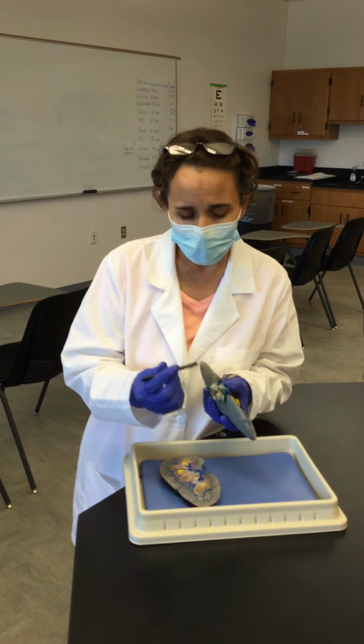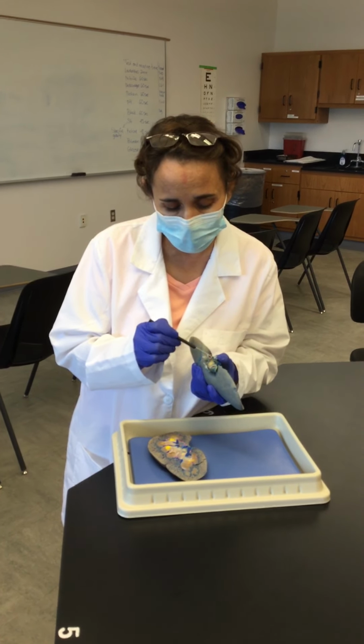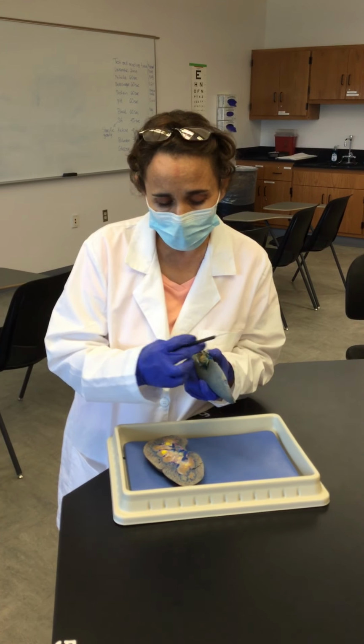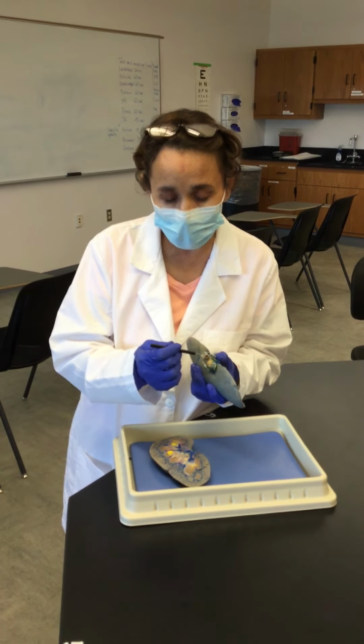And then the way for us to tell what structure is which is just by looking at the thickness of the structure, and also by looking at the diameter, if it's large, if it's small, or if it's round, and if it's irregular. And according to the texture of the structure, if the wall of the structure is very resistant, and if the lumen or the diameter is small and it's rounded, it will be the artery. If the lumen is irregular and it's large and the wall is soft, that will be the vein.